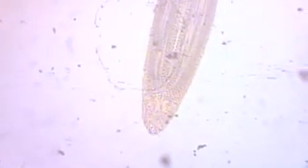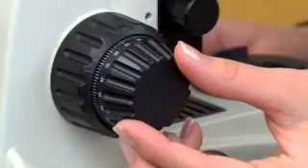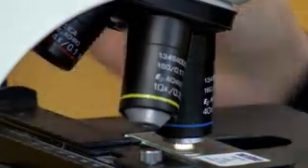Then move to the next highest objective lens, 10x, and refocus. Your specimen should be nearly in focus, and you should only need to use the smaller, fine focus knob. Again, center the specimen, and you are ready to move to the highest power lens, 40x.